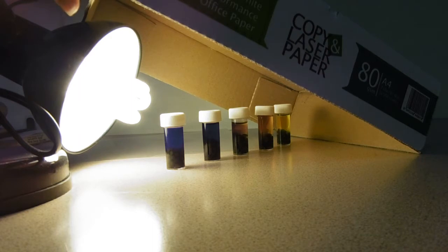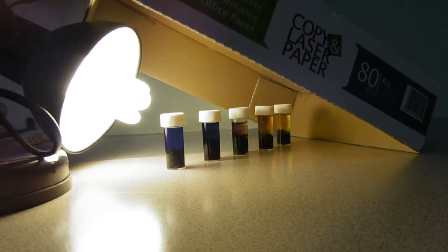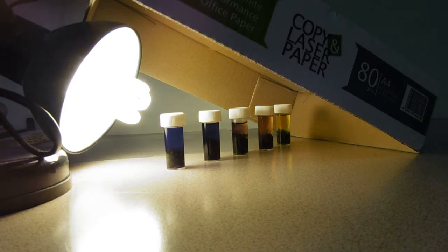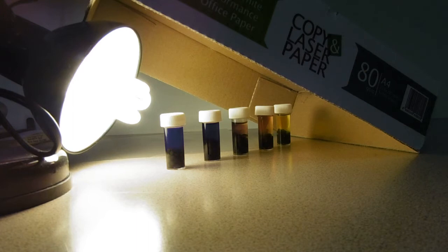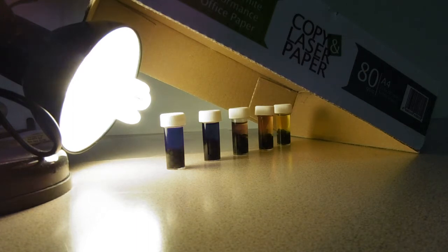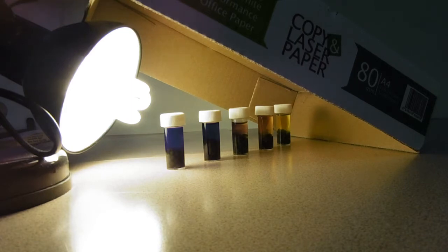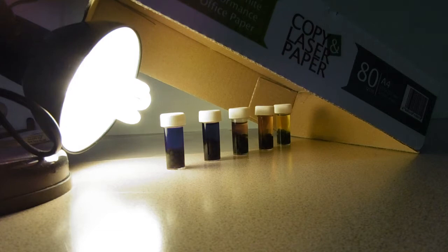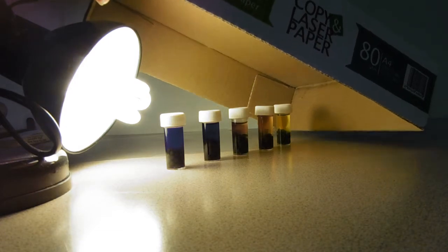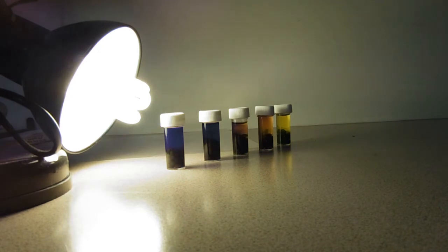You'll see we've got a cardboard box, and that's because we're just in a room where Miss Carter and Miss Allen work and they have the lights on. The cardboard box is just to keep all the extraneous light out. I'm just going to take that away so that we can probably see it a little bit better.